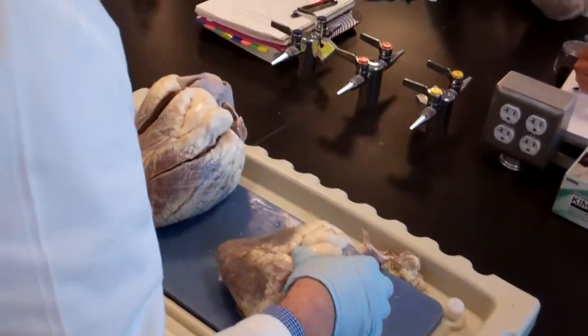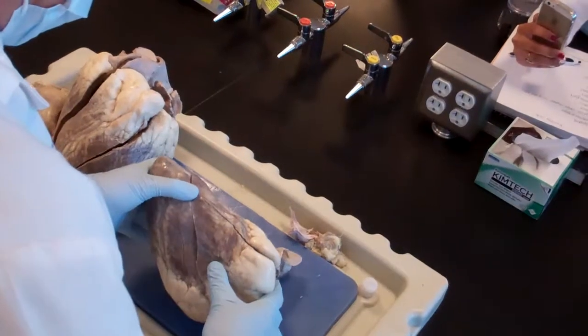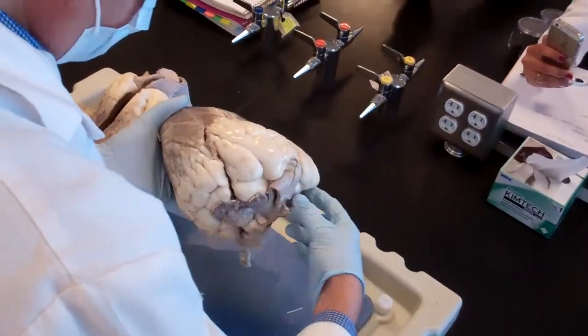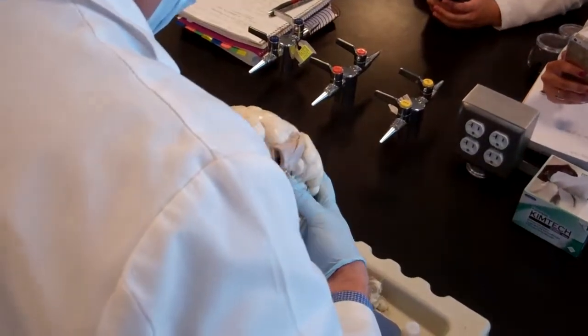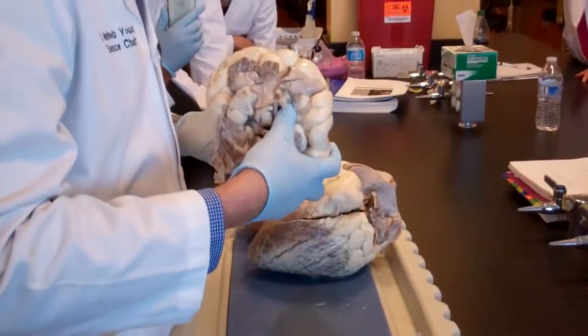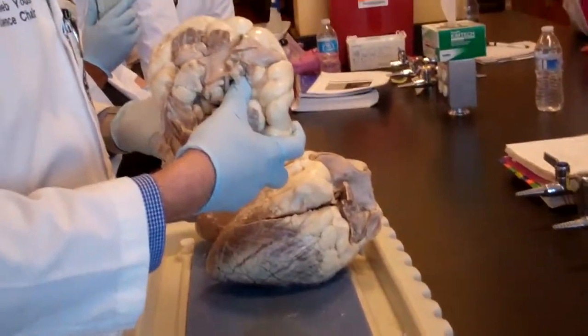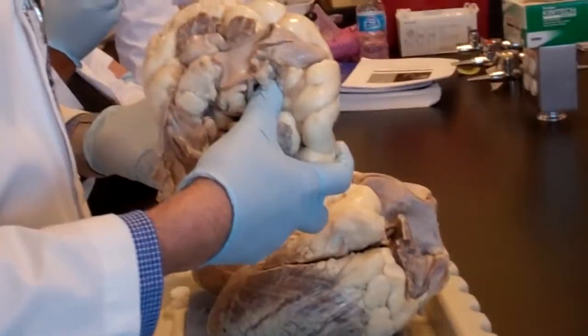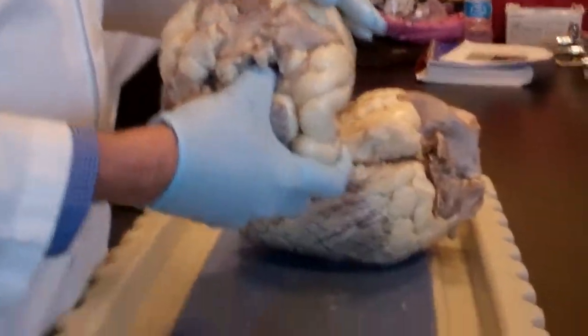Okay, so the first thing to identify in the heart is to understand first its location. So typically the heart is located this way in a human being. This way, so this is pointing to the left. Remember, we're talking here about anatomical position. Okay? So if I would be looking at the heart, this is the anterior surface.